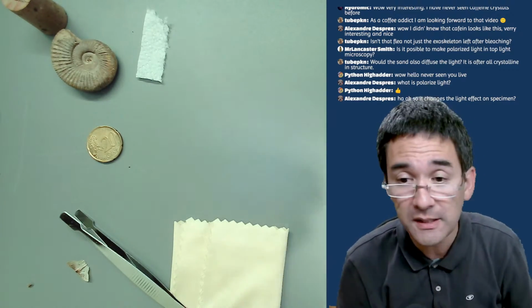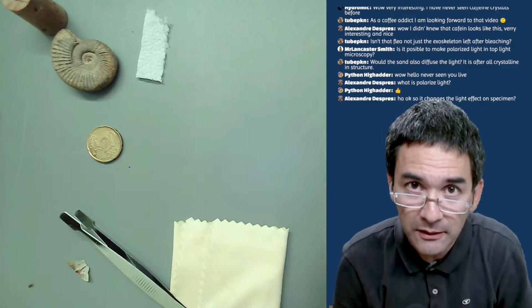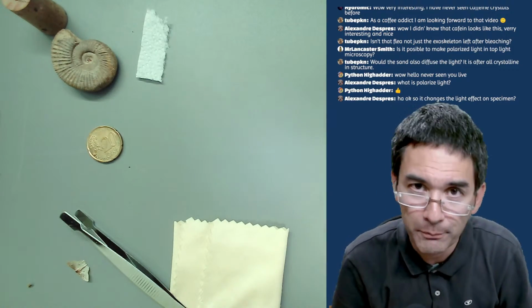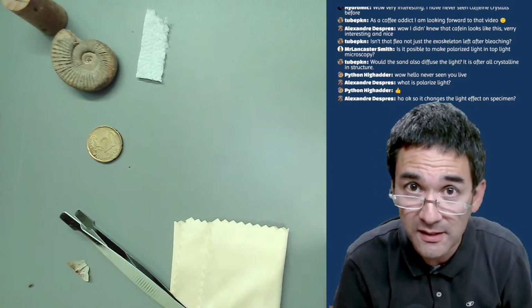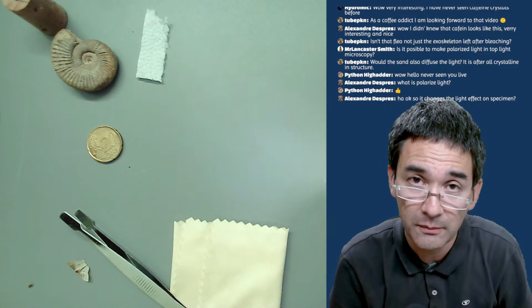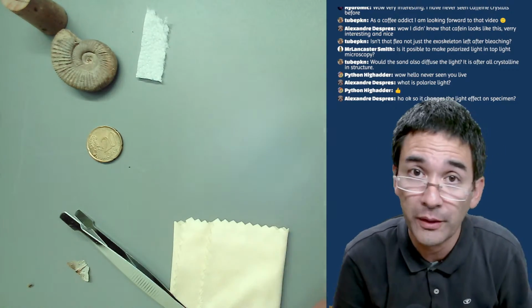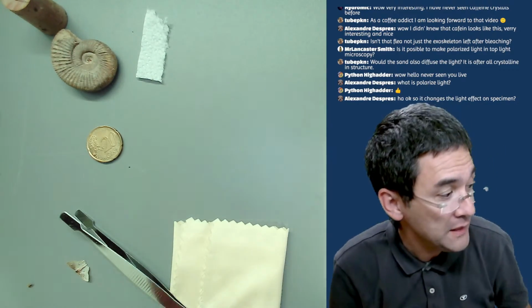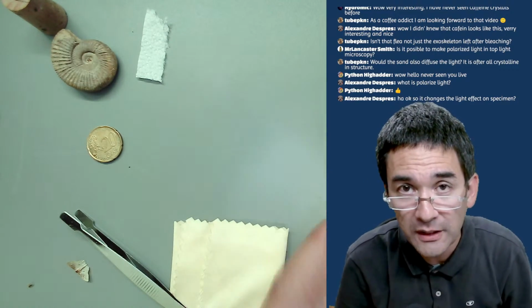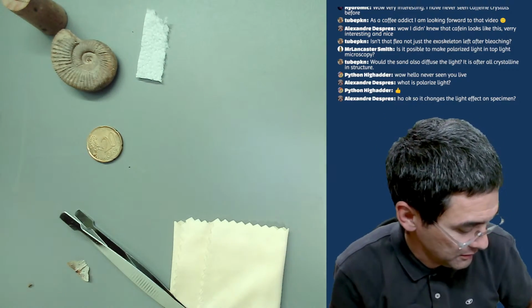But essentially, if the specimen is optically active, that's what it's called, then it's able to interact in a specific way with polarized light, and you get special effects, color effects. Certain crystals don't do that. For example, salt crystals, of table salt, are not optically active, and when you put polarized light through them, there is no effect. But caffeine is optically active, and therefore you get nice colors. So that's basically the thing here.